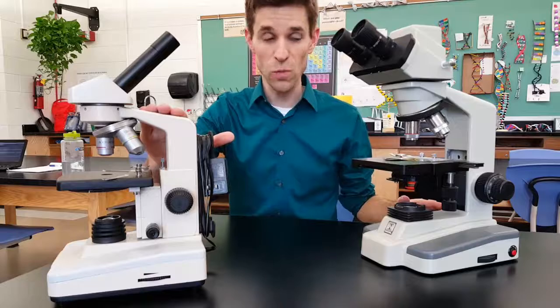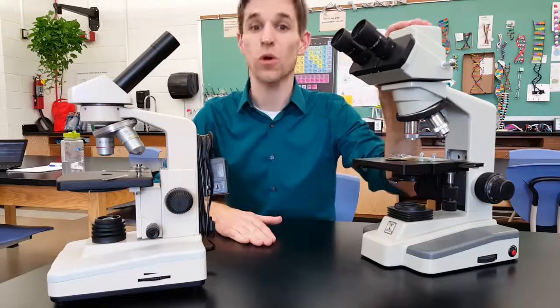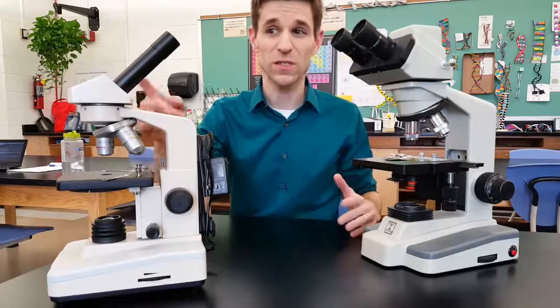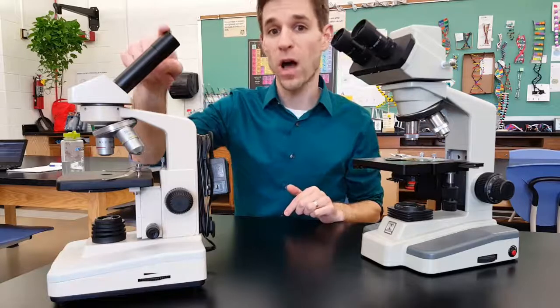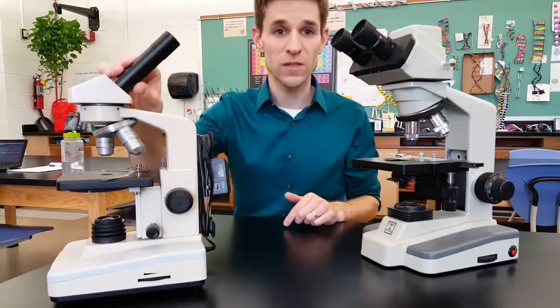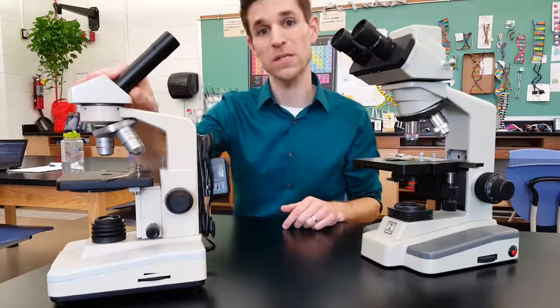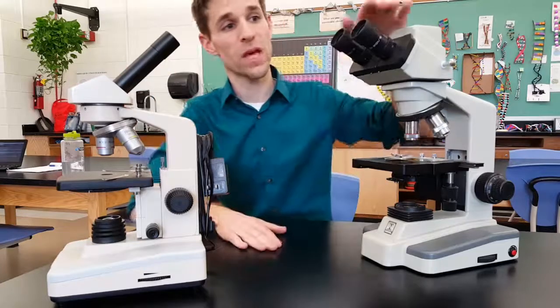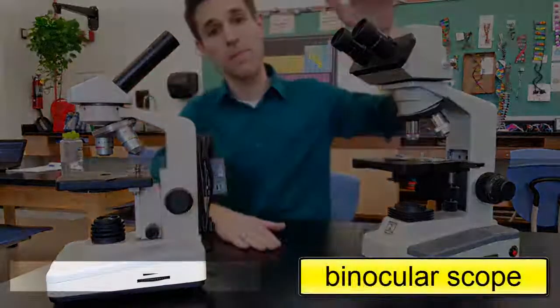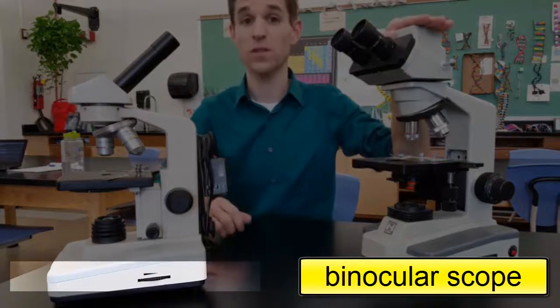This right here is the student scope. This one is the teacher scope. The teacher scope can be used by students, but only if you show proficient use in the student scope. You'll notice the immediate difference is the number of eyepieces. This is a monocular scope on the student scope — it only has one lens to look through. This one has two eyepieces; this is a binocular scope. The parts of the microscope, aside from that, are very much the same.